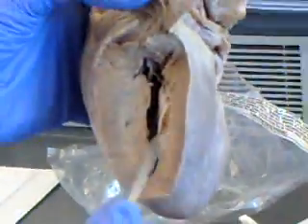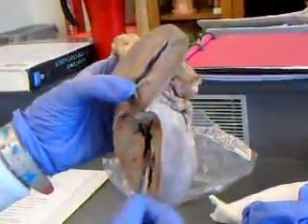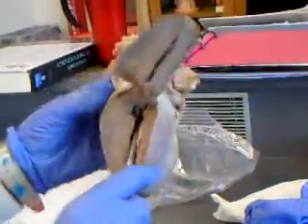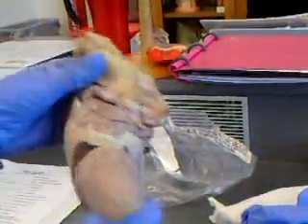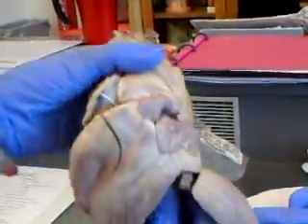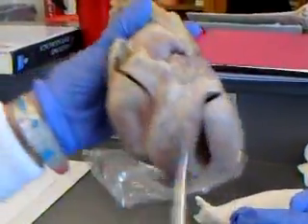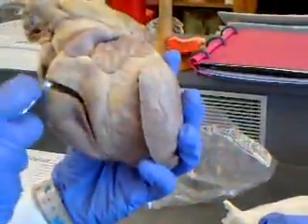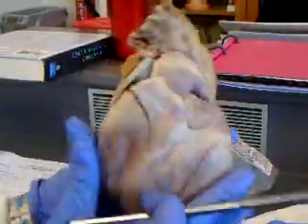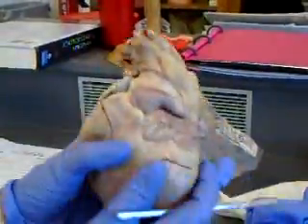So our journey is going to start in the left ventricle, and the blood's going to flow through the aortic valve, right? The aortic semilunar valve, up into the aorta. So here's where we cut our aorta in an attempt to find a coronary artery. Here's the aorta, the aortic arch, where it's going to flow through the rest of the body. It's going to return from the systemic circulation.